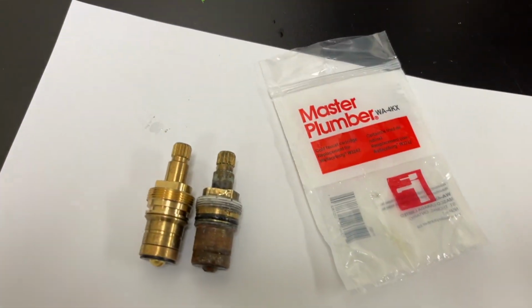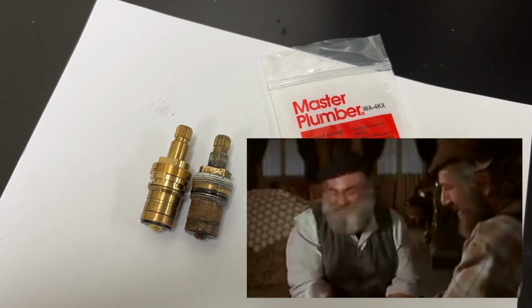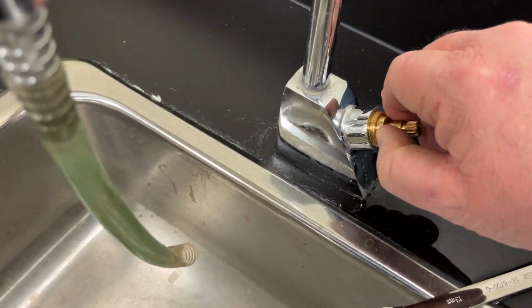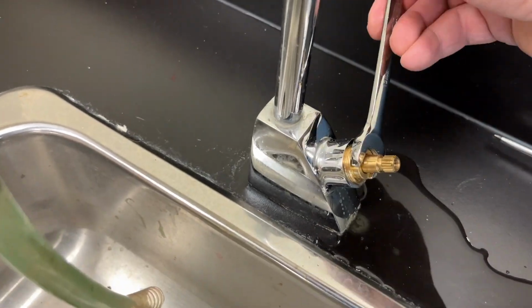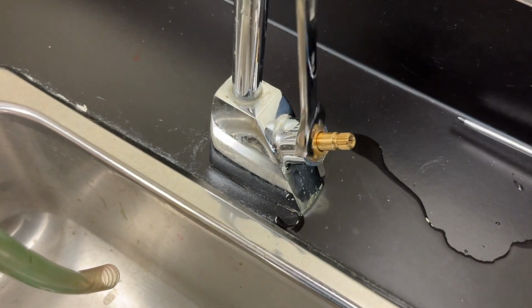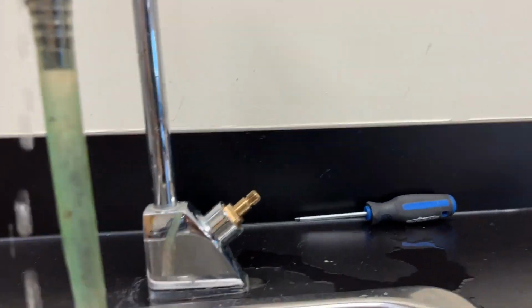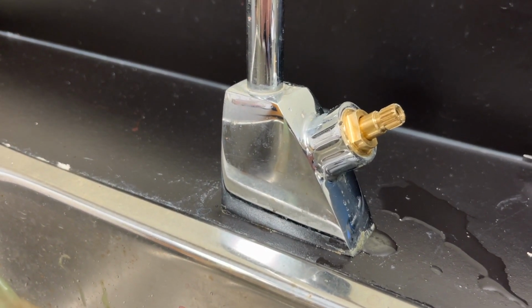Moment of truth. It's a match! You've made me a happy man. Good. Let's drink on it. Wow. It actually fits. Oh, you're welcome. You too. Wow. Would you look at that?